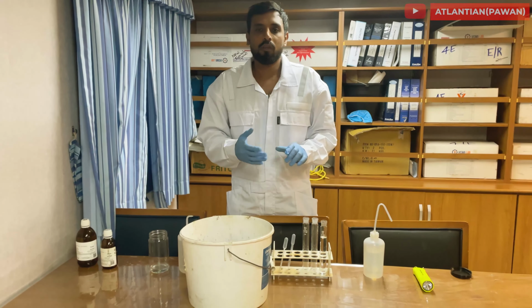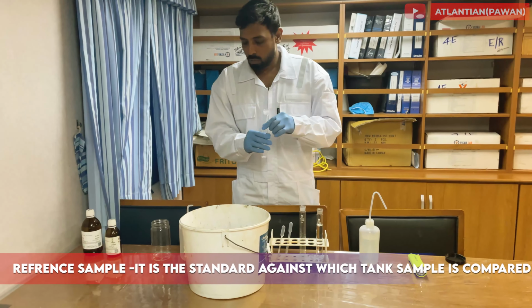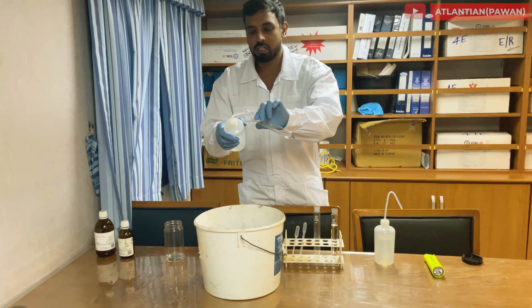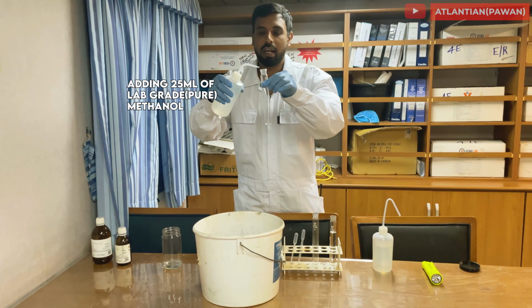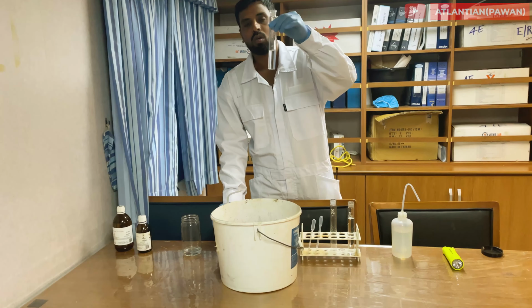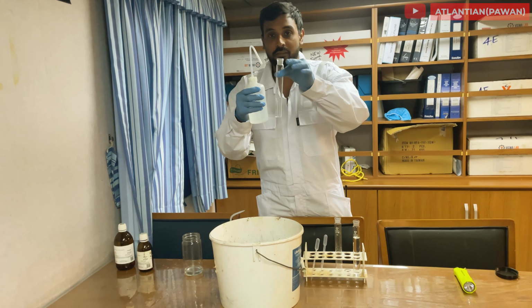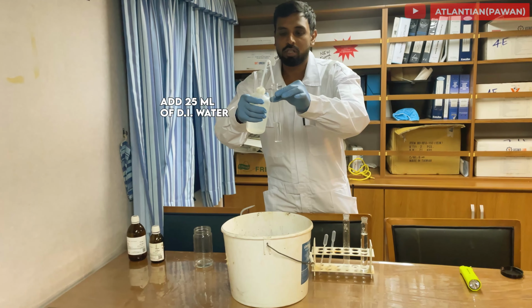For all our tests, we always have to make a reference sample. In the same manner, we'll also make a reference sample. We'll add pure methanol, or lab grade methanol, as you can call it. First I will rinse this Nessler tube. After rinsing it properly, I'll add 25 ml of methanol. So I've added 25 ml of pure methanol in my Nessler tube, and then I'll add 25 ml of DI water. So this becomes my reference bottle. With reference to this, I will compare my tank wall wash sample.